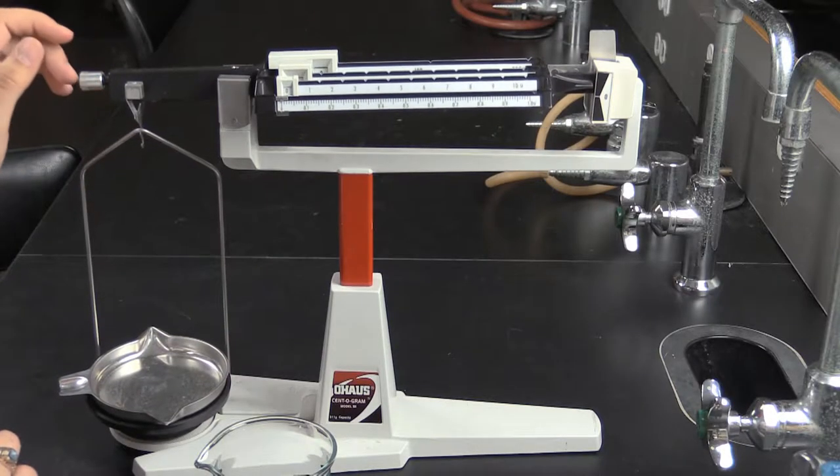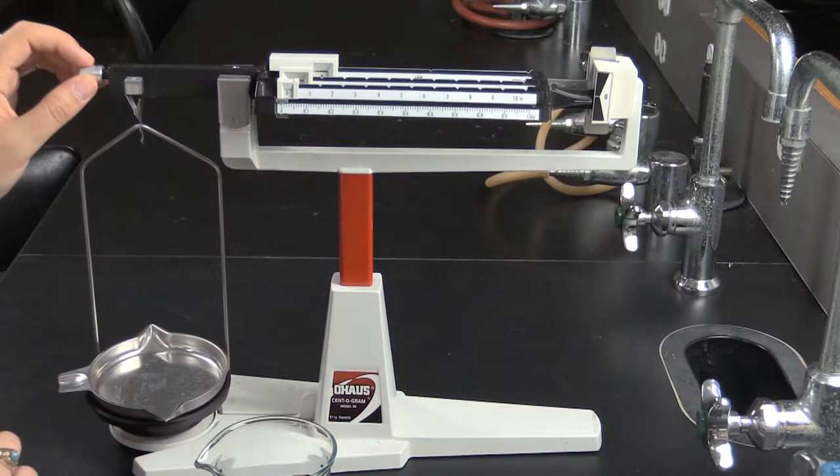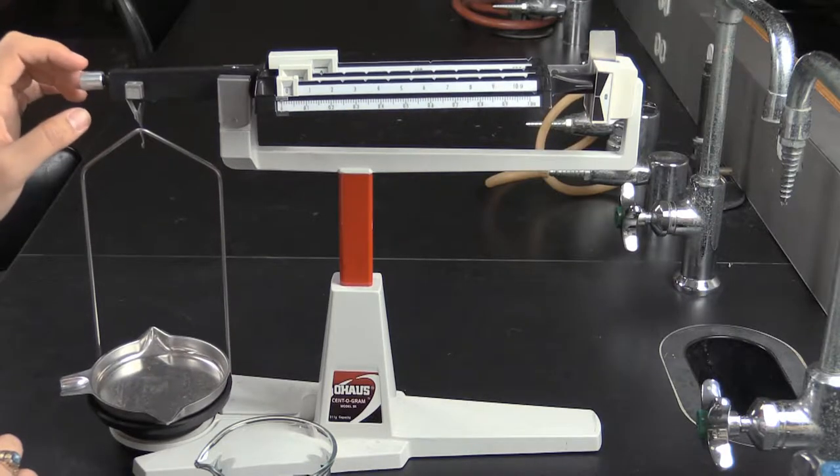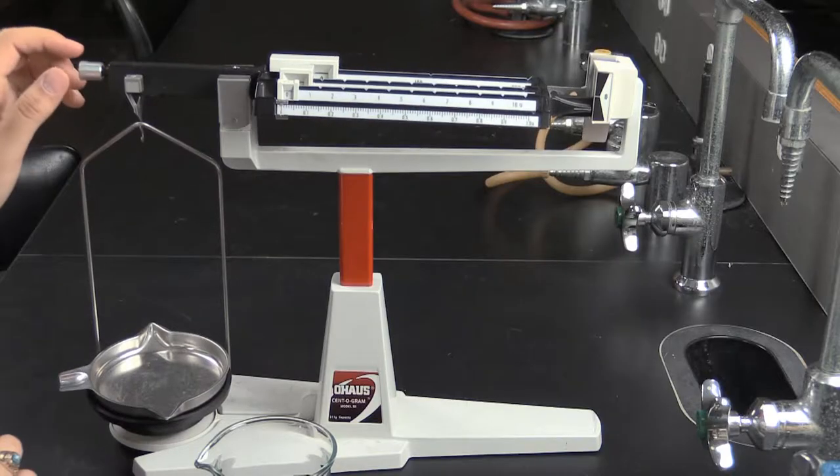Unlike the electronic balance, with the quad beam balance you can see where the name balance comes from. Like the electronic balance, we must first zero the balance.